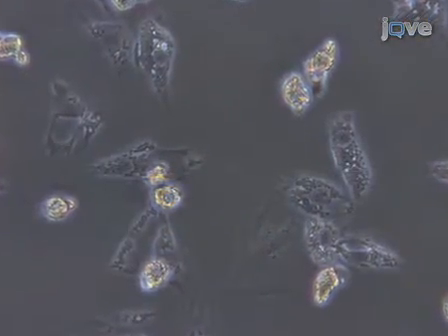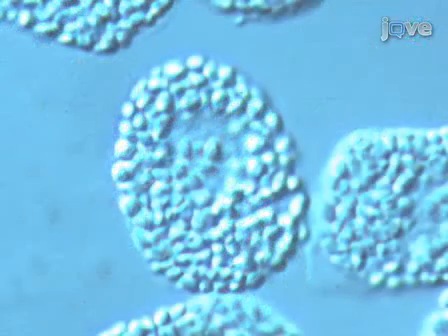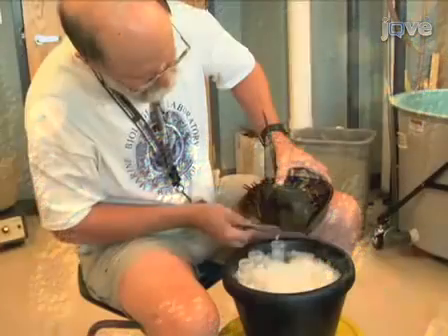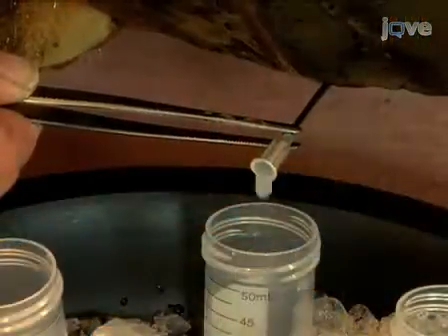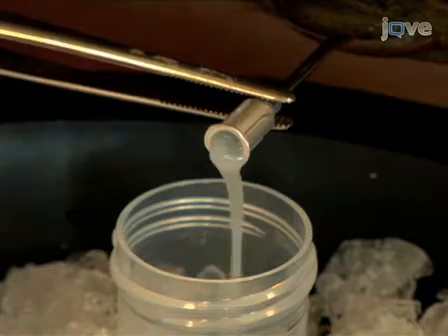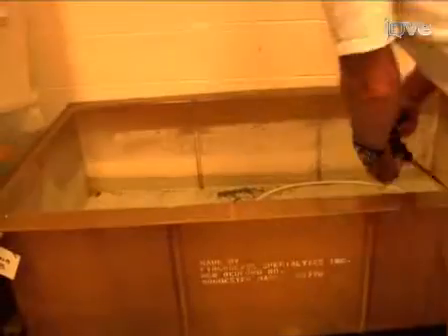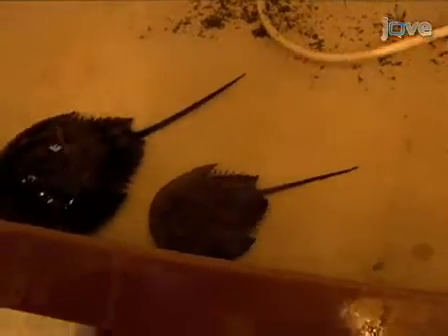The blood of the horseshoe crab is known as the hemolymph and moves throughout the body via an open circulatory system. Horseshoe crab hemolymph has only one cell type, the granular amoebocyte. The amoebocyte is responsible for secreting the proteins of the blood clotting system and proteins and peptides of the immune system. The study of the cells and proteins of the blood is facilitated because of the ease in obtaining large quantities of blood — 50 to 200 milliliters from a single animal — in as little as 10 minutes. Bleeding is well tolerated by the animal, and animals can be bled repeatedly once or twice a month. Now that we've learned a bit about the horseshoe crab, let's move on to preparing to collect its blood.